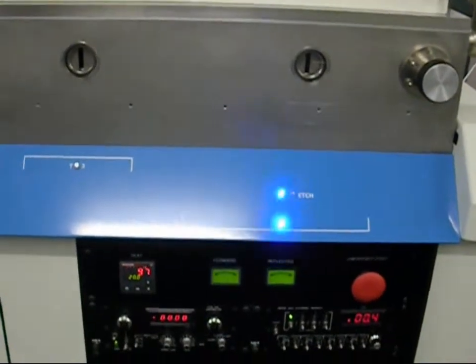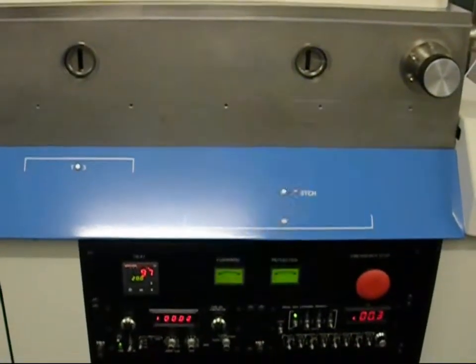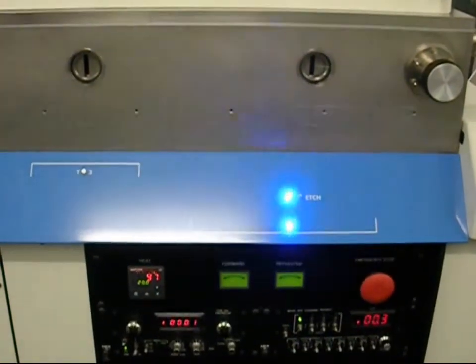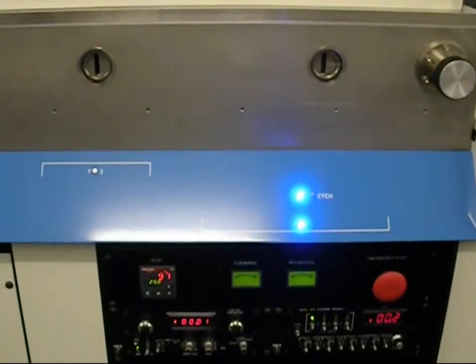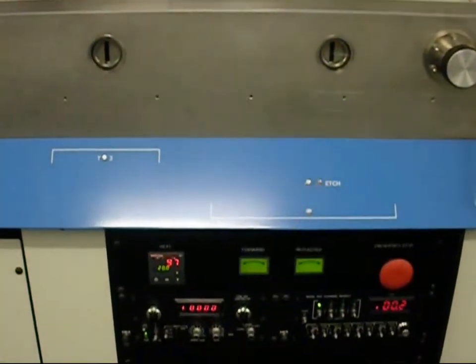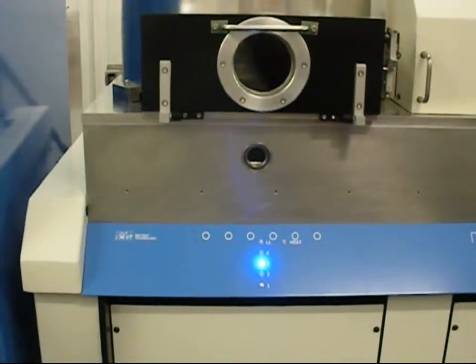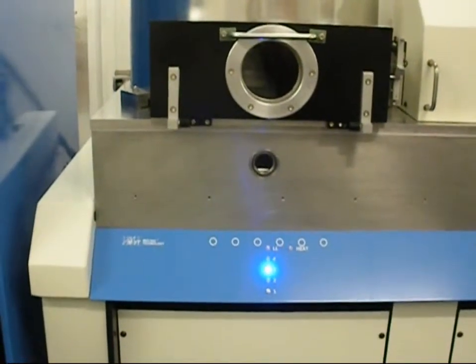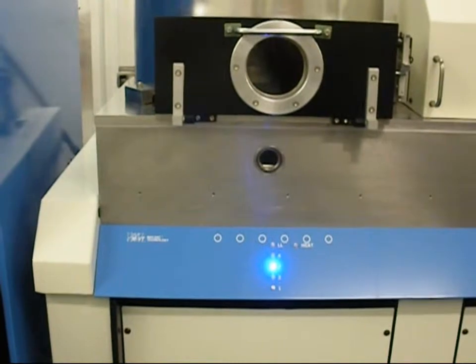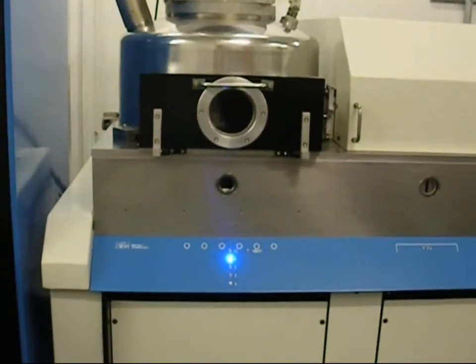This substrate cooling step is unique to the MAT-VAC system and can be pre-programmed at any stage of a process recipe. Now that substrate cooling is completed, the pallet will be placed back onto the pallet carrier and relocated to the left side of the main process chamber in preparation to be exchanged out.